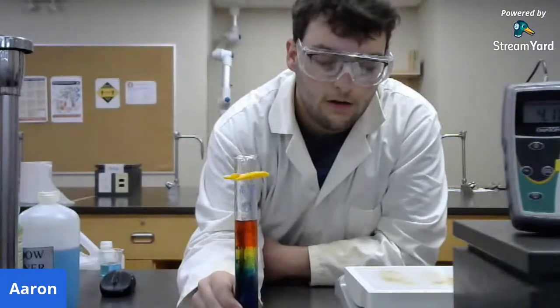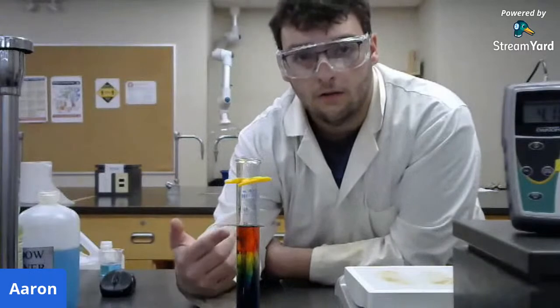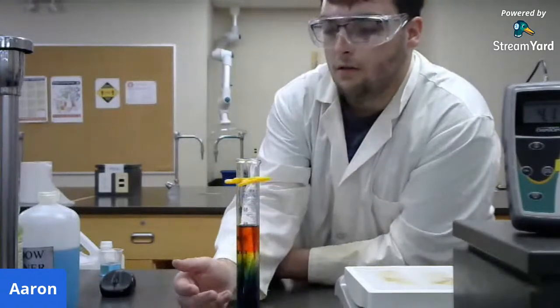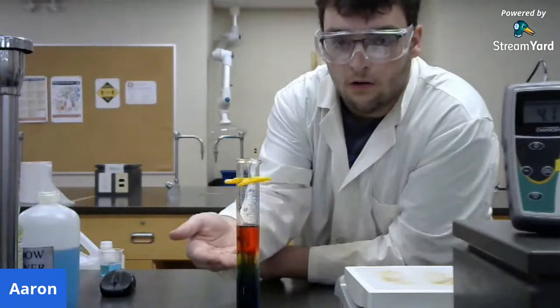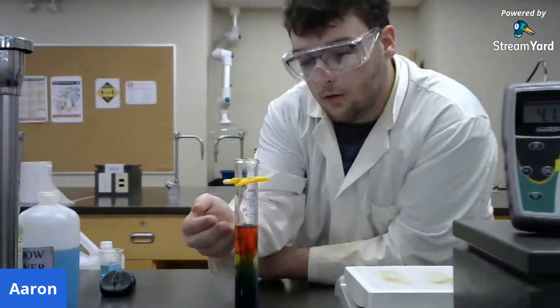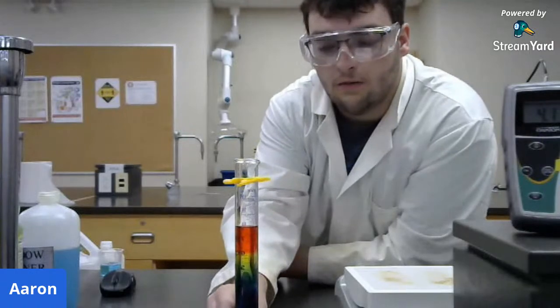So if you recall that indicator scale, we know that it's likely because all of the pHs are different. What happened was I didn't mix this, so it just settled, with the hydrochloric acid on top and the sodium carbonate going down to the bottom because it's denser. So up here our pH is lower because it's more acidic, and down here our pH is higher because it's more basic.